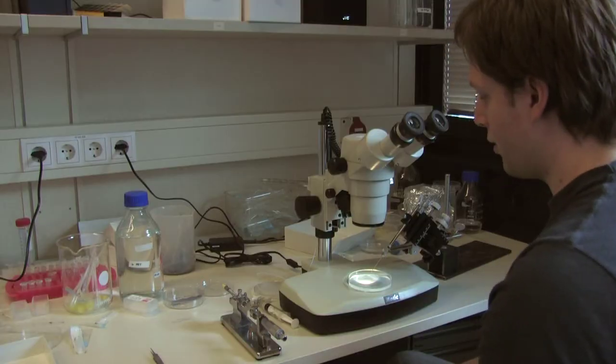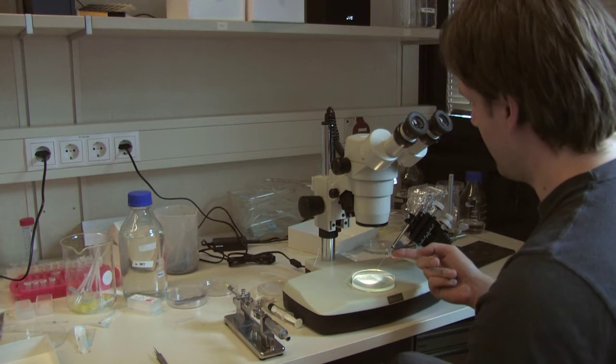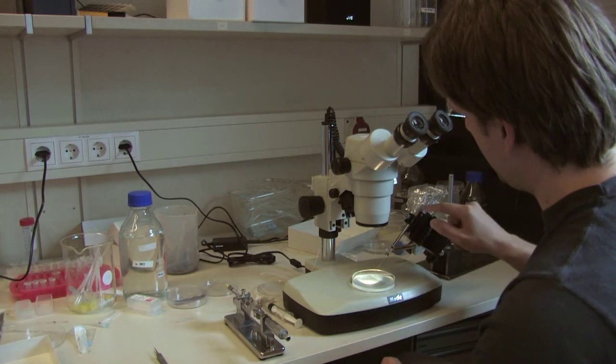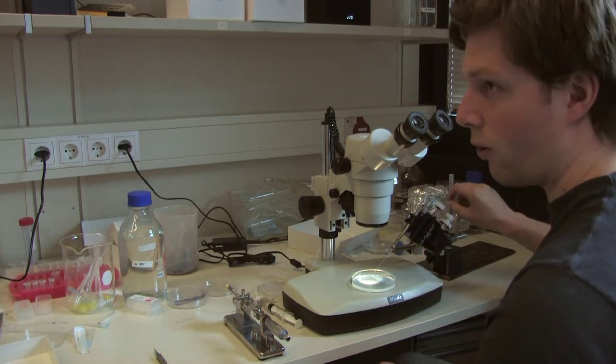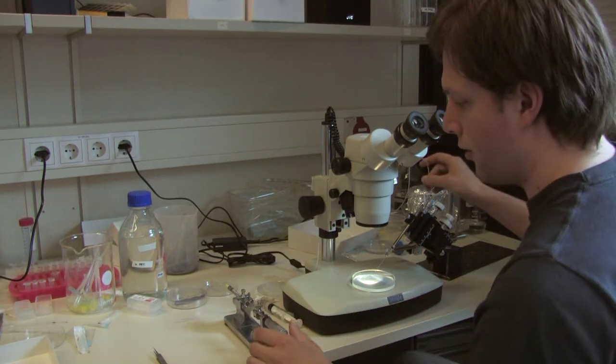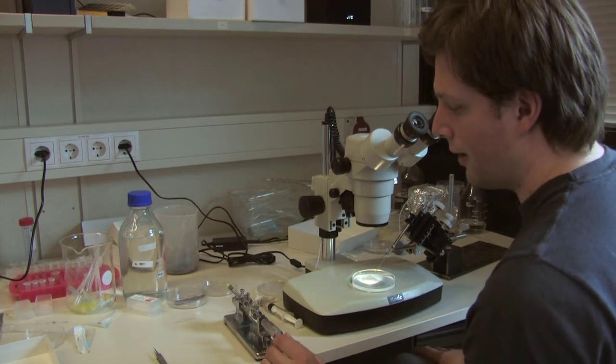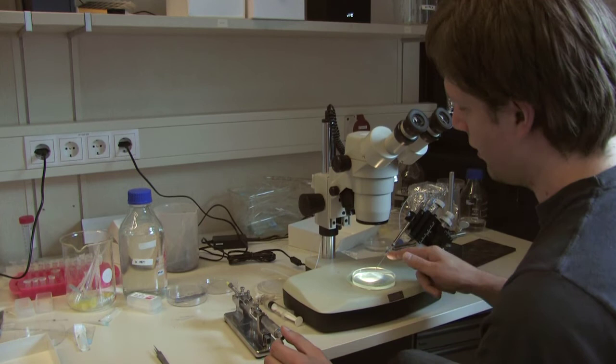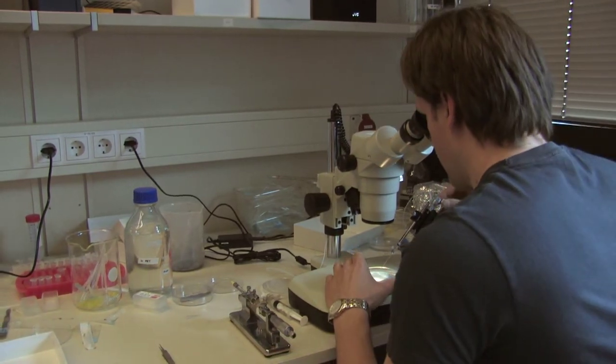For our transplantation assay, we use a needle to soak up cells. So the needle is connected to this tube, which is completely filled with oil. And by using this micromanipulator, I can set the oil level in the needle, and this allows me to soak up cells from an embryo.